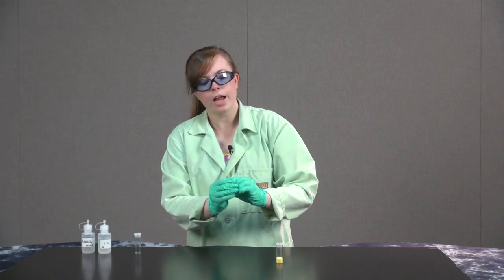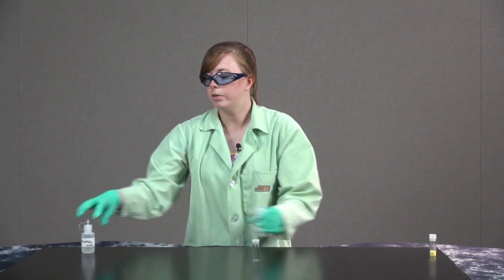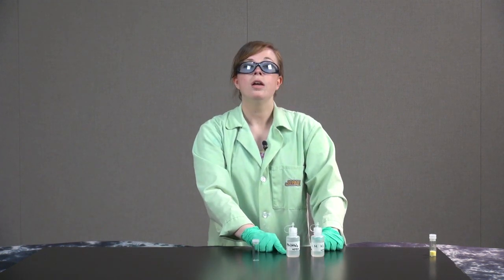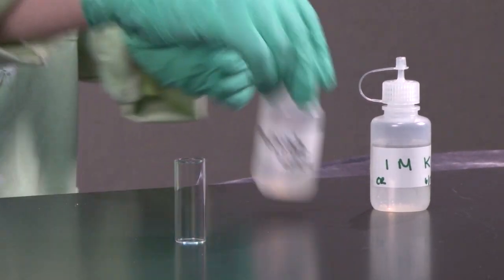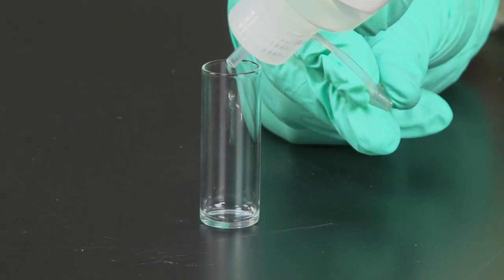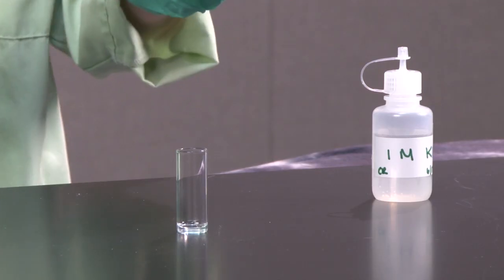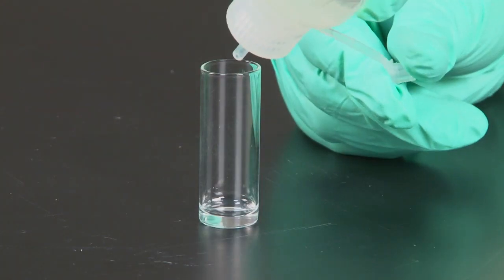I'm going to do this reaction again, but this time instead of the reactants being solids, I'm going to have the reactants in aqueous solution. As we can see, they're both colorless liquids, and so when I add them to the vial, we'll see what happens. A few drops of lead nitrate and then a few drops of potassium iodide.